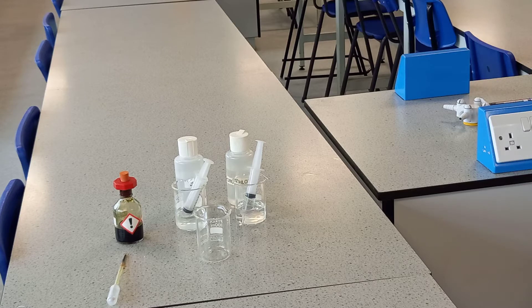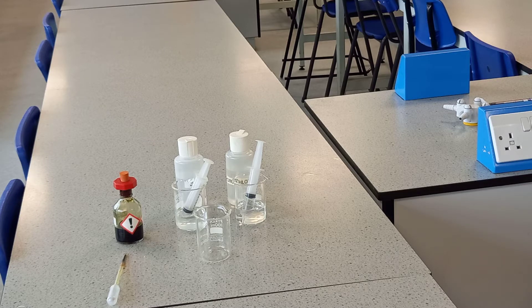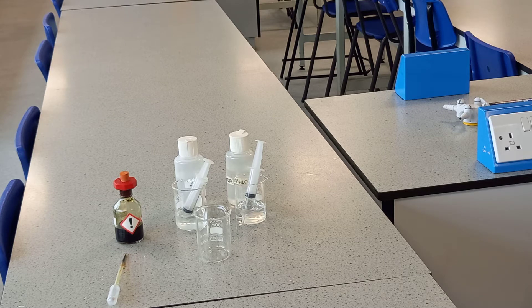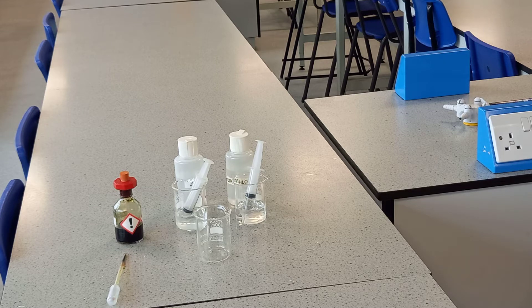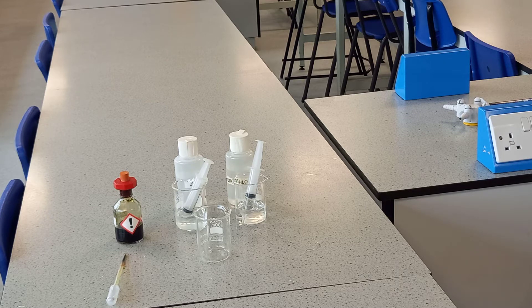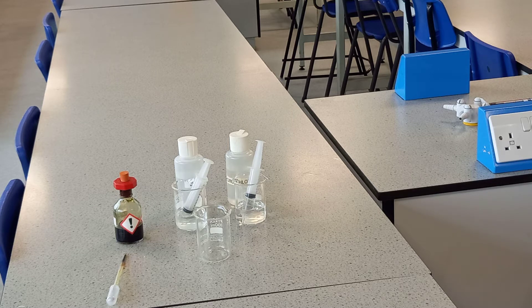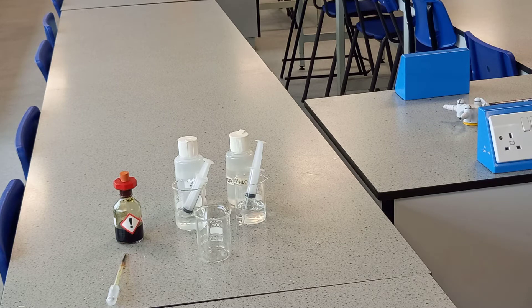In this video we are going to look at neutralisation. Neutralisation is a reaction that occurs when an acid and an alkali are combined. I have in my beakers some acid on the right hand side and some alkali on the left hand side. I'm going to be using universal indicator liquid in this experiment rather than the paper that you have previously seen.